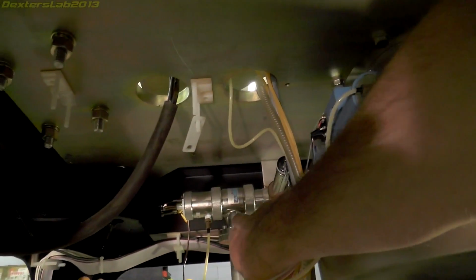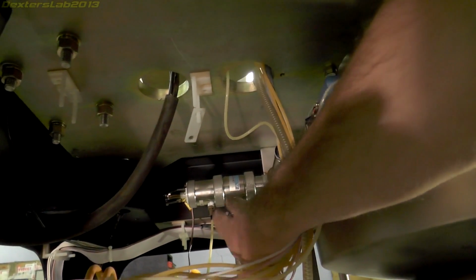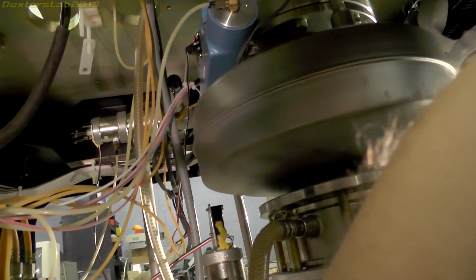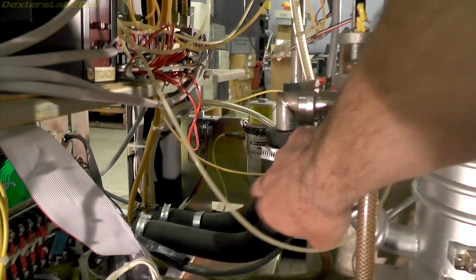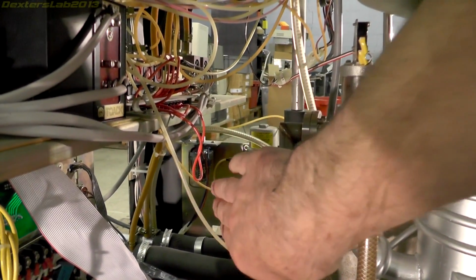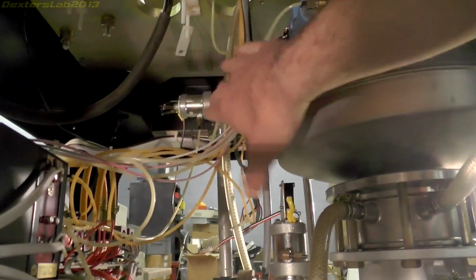Over in the back there, these bits here, this is part of the sample exchange chamber vacuum system. So there's two pipes that run out to the back here. I think the actual main console, the control console, sorry, would have had at least one roughing pump, possibly two. So I think what they used was a roughing pump for the main chamber, and then possibly a separate one for the sample exchange chamber.